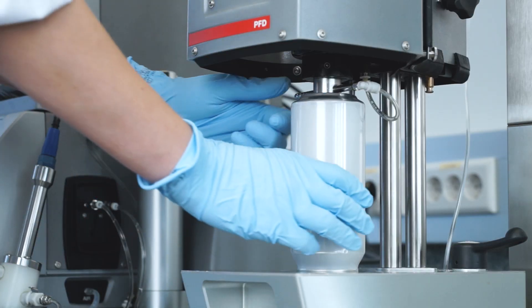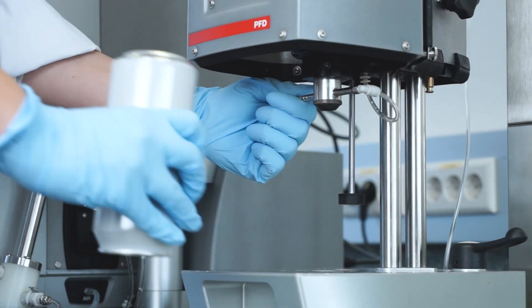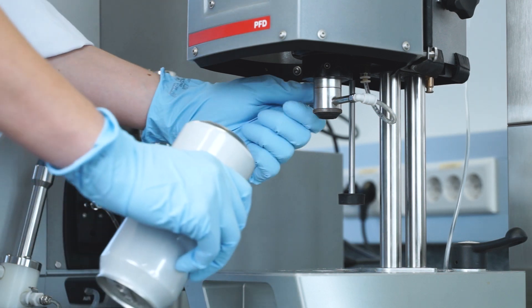Packages of identical size may easily be replaced by lifting the gasket. This simplifies the operation.